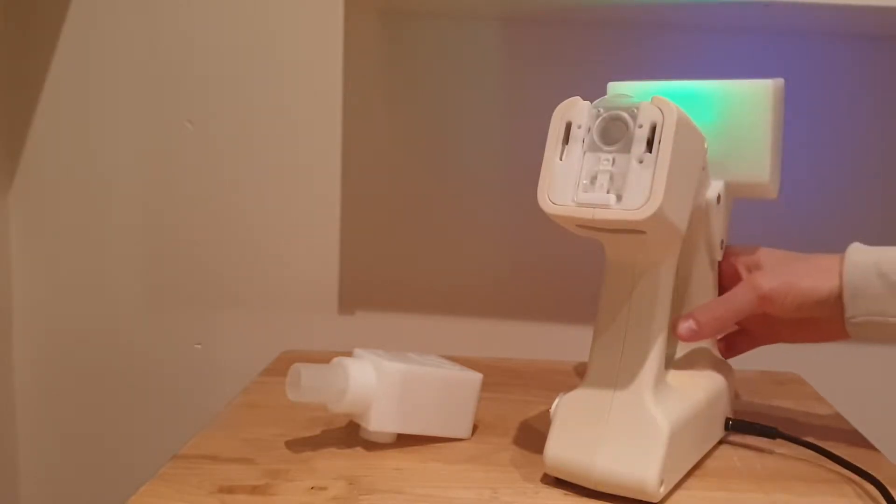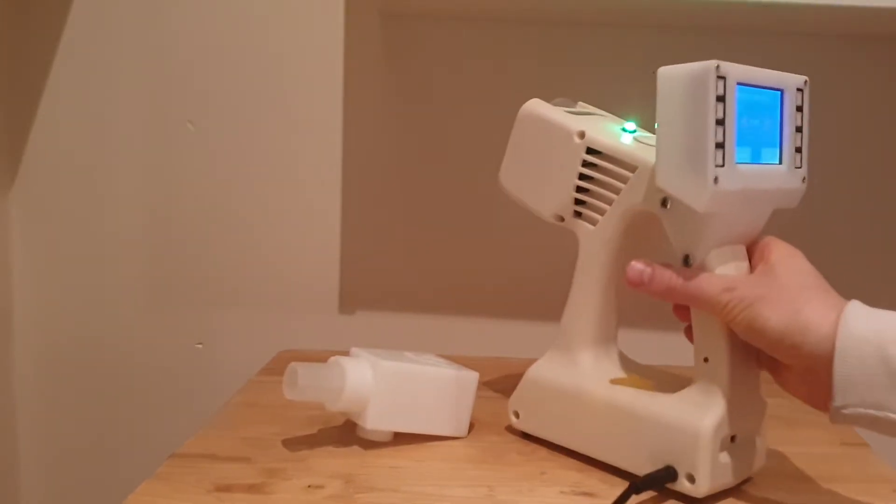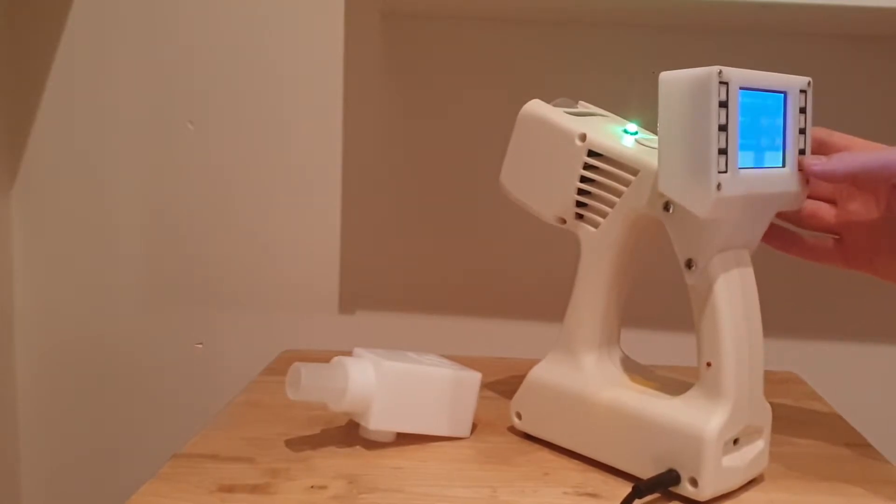So what I'm going to do is, at the moment it's not doing much, so what I'll do is I'll turn around. I'm just going to go okay on this. I'll just go okay on this.